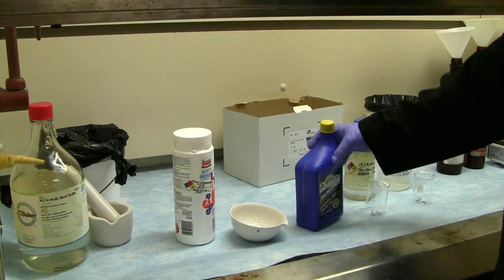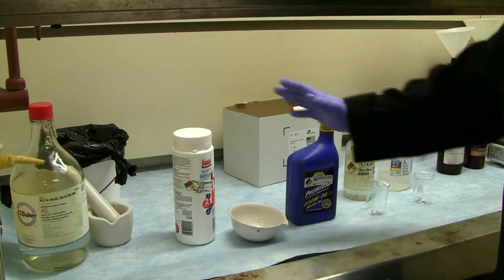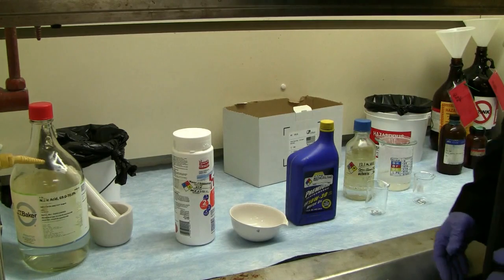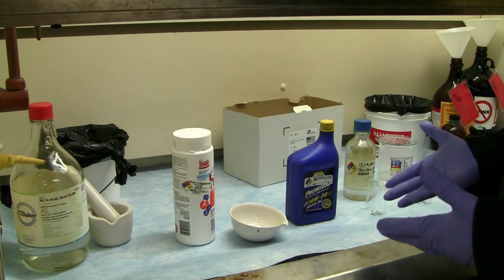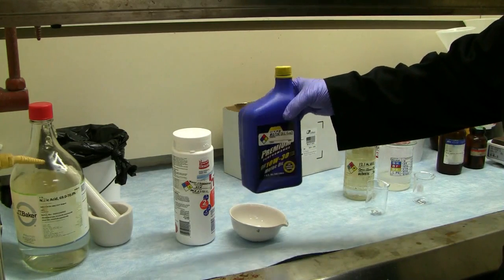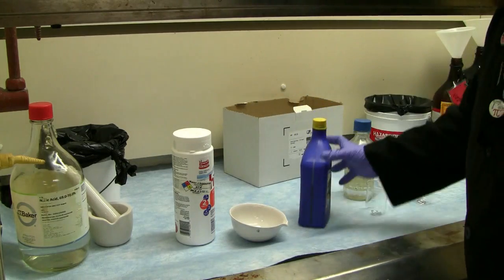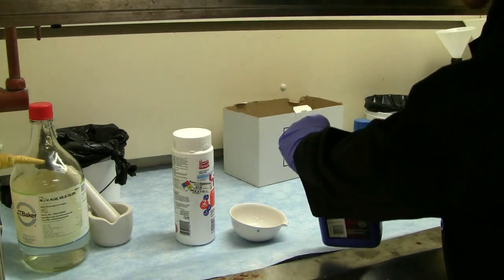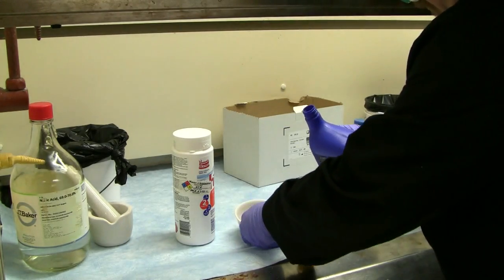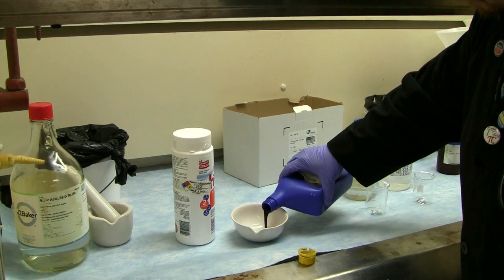So I like to do this demonstration because these are common chemicals you can find at your home, and it doesn't have to be this. It could also be calcium hypochlorite, sodium hypochlorite, things of that nature. Anything that's got a strong oxidant capacity. And then of course your feed, your fuel stock, which in this case is motor oil, your long chain hydrocarbon and multi-branch hydrocarbon. So what I'm going to do now is I'm going to introduce a proportional amount of my motor oil with my HTH, or my pool shock.